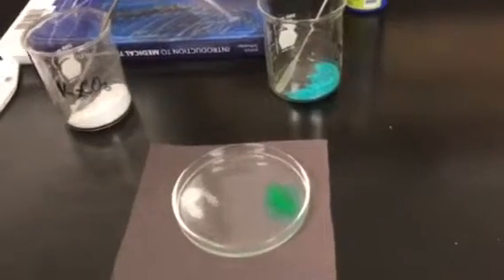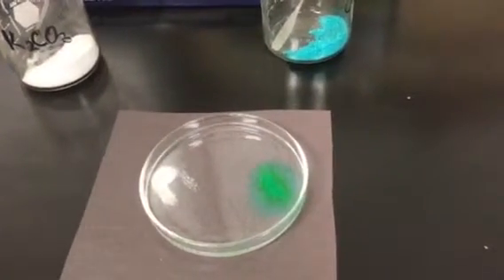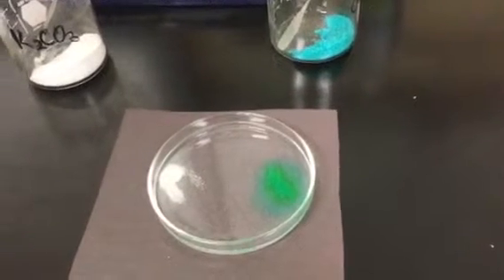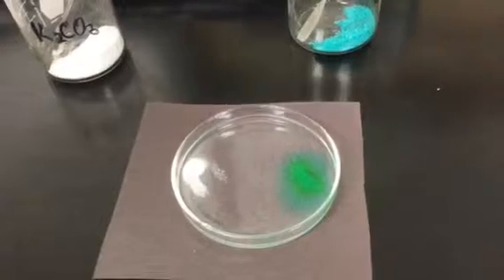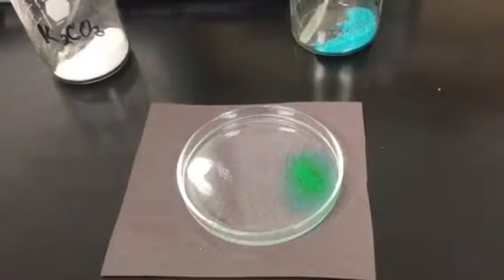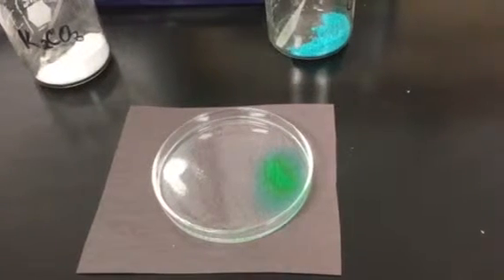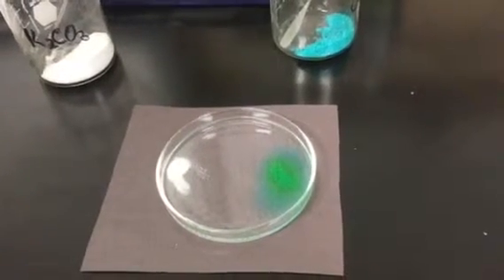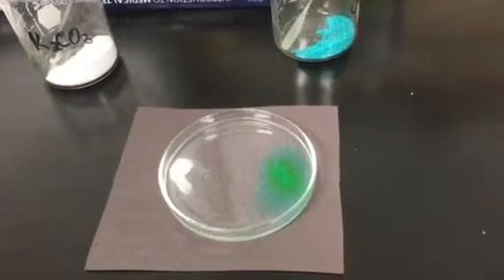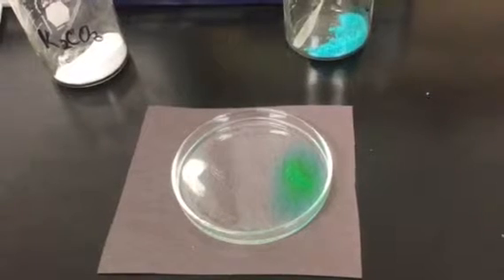What's happening now is that the two salts are dissolving. I'm going to tell you a few things while we're watching this. First of all, I want to remind you that salt just means an ionic solid, some kind of solid that's made of ions. You've got a cation and an anion together. What we're seeing here is that things are dissolving, starting to spread out.